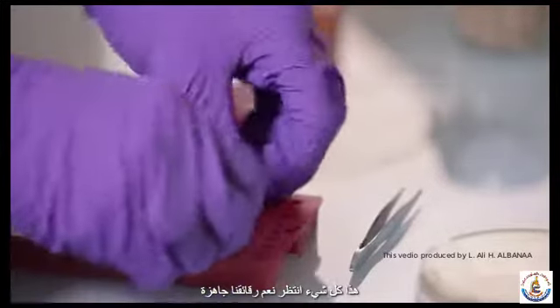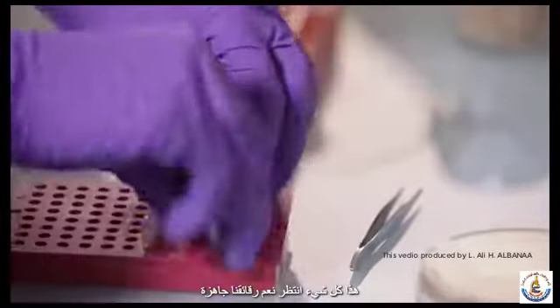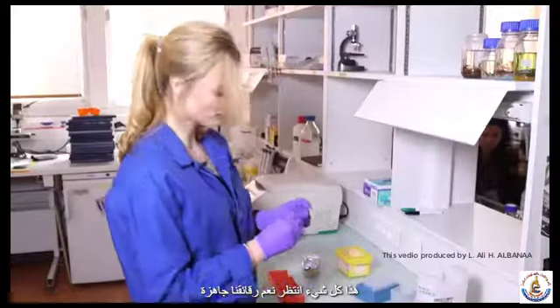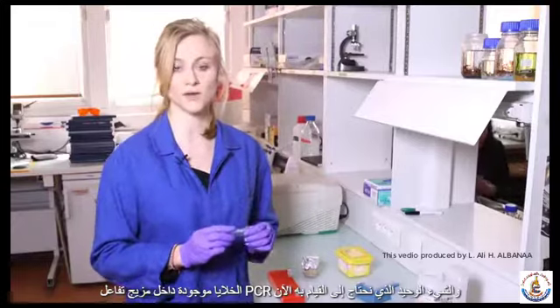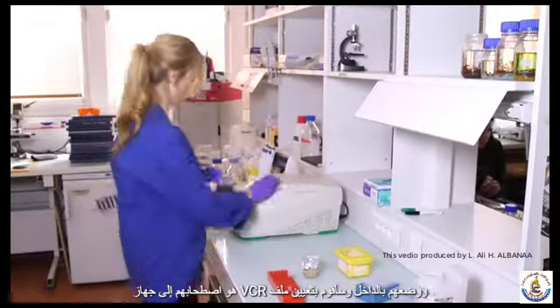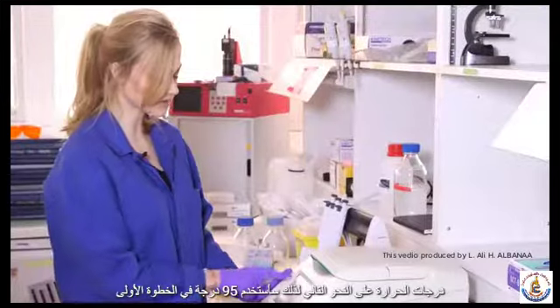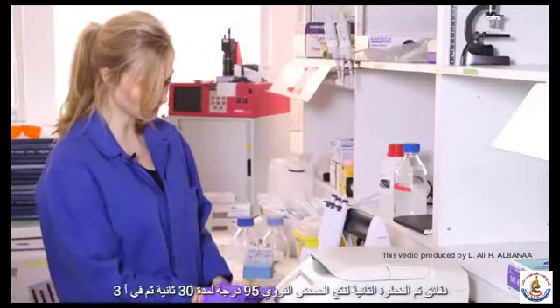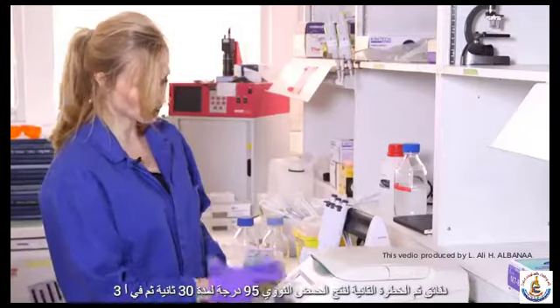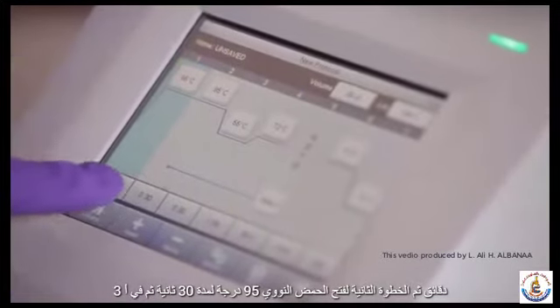So that's it. Oh wait. Yes, our tubes are ready. The cells are inside the PCR reaction mix, and the only thing we need to do now is take them to the PCR machine, place them inside, and I will set the temperatures as follows. So I'm going to use in the first step 95 degrees for 3 minutes. Then in the second step, to open the DNA, 95 degrees for 30 seconds.